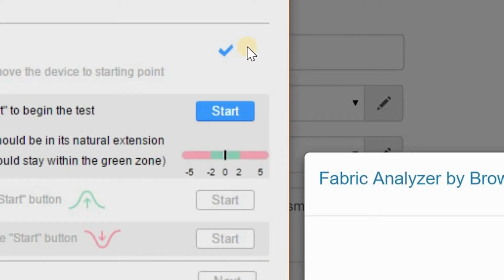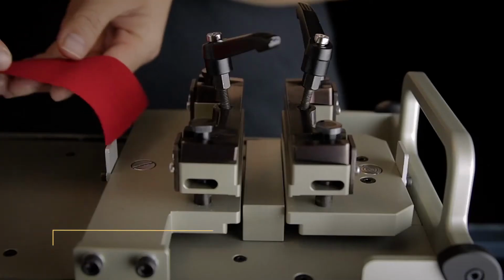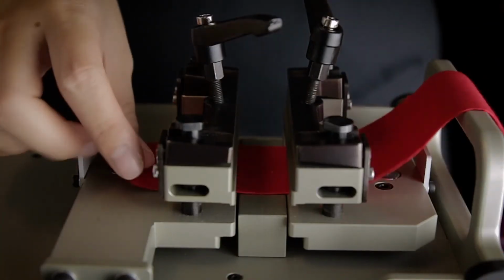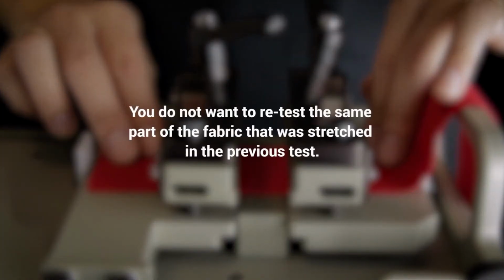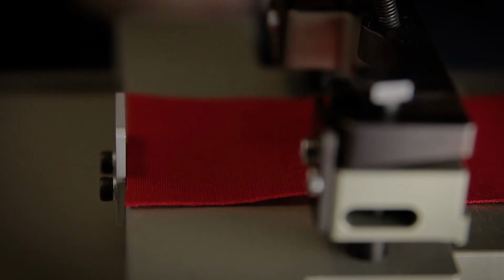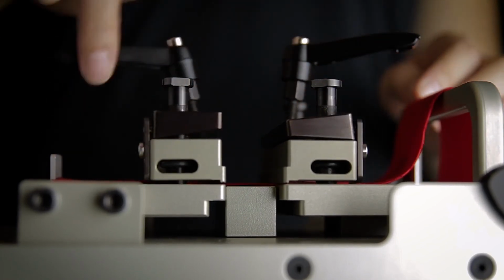Once the Start button turns blue, position the small spacer into place between the movable arm and the fixed arm. Position the same sample fabric under the clamps so the untested side of the fabric lays between the movable and fixed arm. You do not want to retest the same part of the fabric that was stretched in the previous test. Ensure that the fabric is aligned with the stopper on the movable arm. In some cases, the fabric may not reach the stopper. This is okay. The main priority is to test a portion of the sample fabric that has not been tested in the previous test. Lower the clamps and wind the tightening knobs.